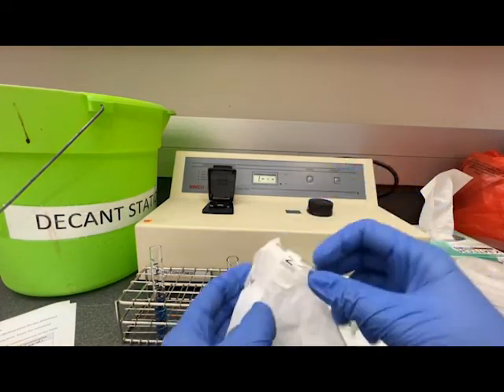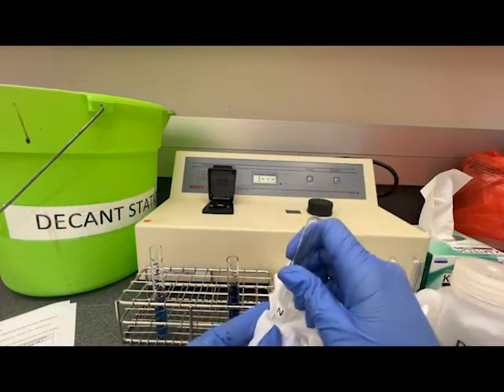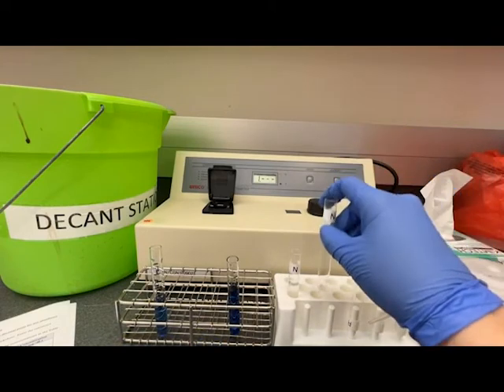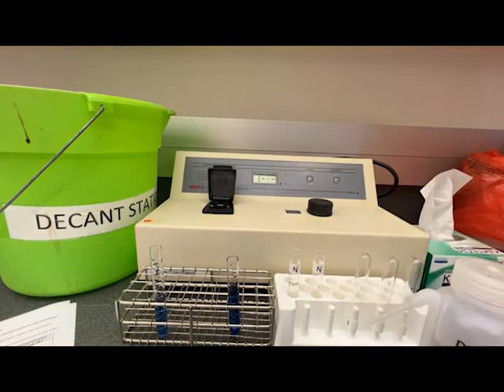You can do that with standards when you know the concentrations. When you're using controls or testing your patient sample, you would need to rinse between each sample since you don't know which samples are high and which samples are low.